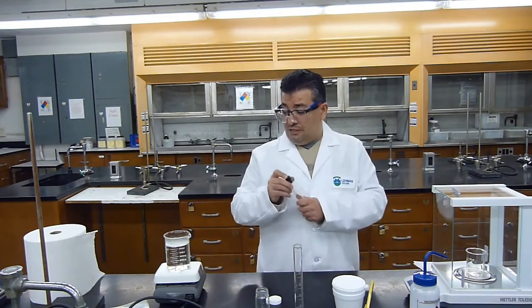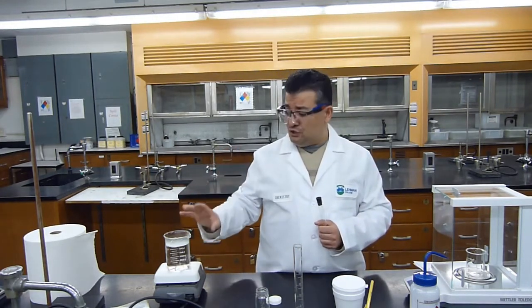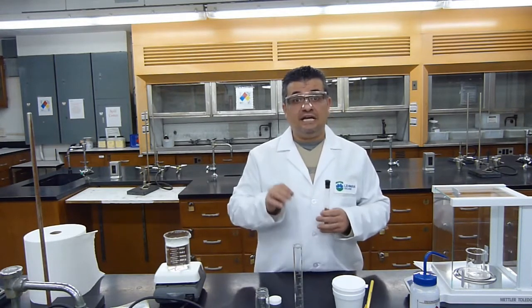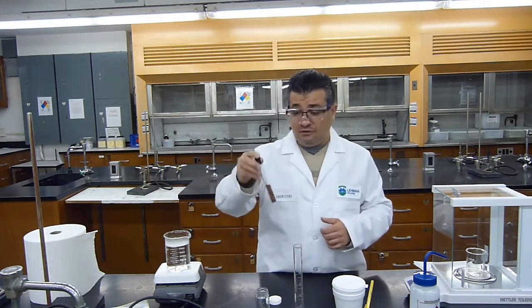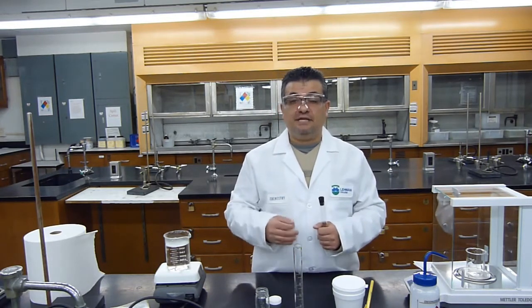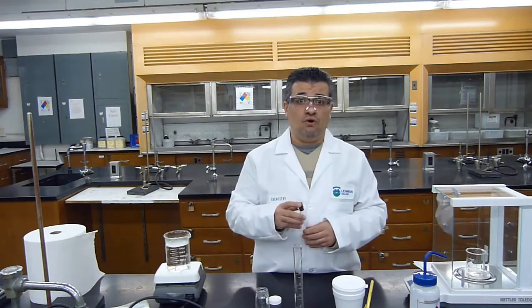So between these 2 masses, I now know exactly how much unknown metal I have to start my reaction. As you can see, my water, because I preheated it, is starting to boil. But you really need to make sure you boil your water. You need to incubate the metal in boiling water for 10 minutes. Now, my water hasn't fully boiled yet, but I could still put the metal inside before the water begins to boil. But it's very important that you begin your timer after the water boils. You do not begin the 10-minute timer before the water boils. The metal has to really sit in boiling water for 10 minutes.